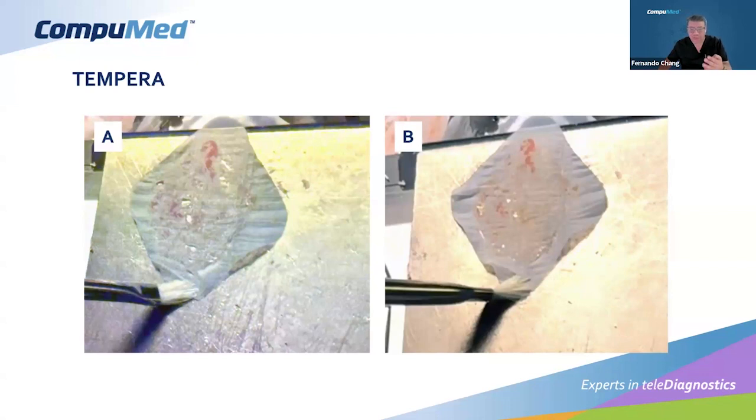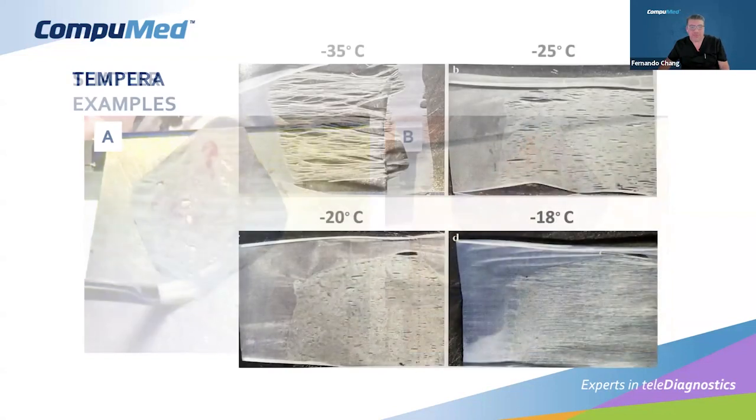And you can identify this visually. You don't need a temperature gun to see when you're going to cut this. Remember, this is an ongoing process and the OR is waiting for our results. So we don't have much time for measurements and going through scientific methods, but we can be observational. Our muscle memory can identify when, like in the left slide, the section is crumpling and starting to have chatter, and how on the right, after we introduce heat, this is not there anymore.